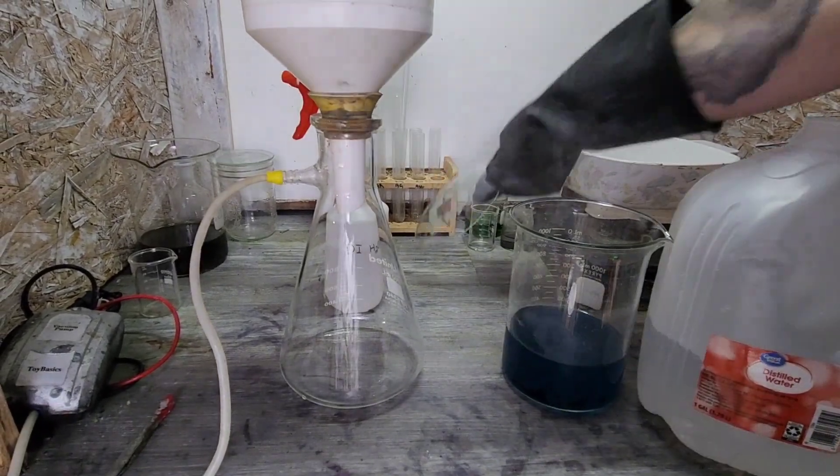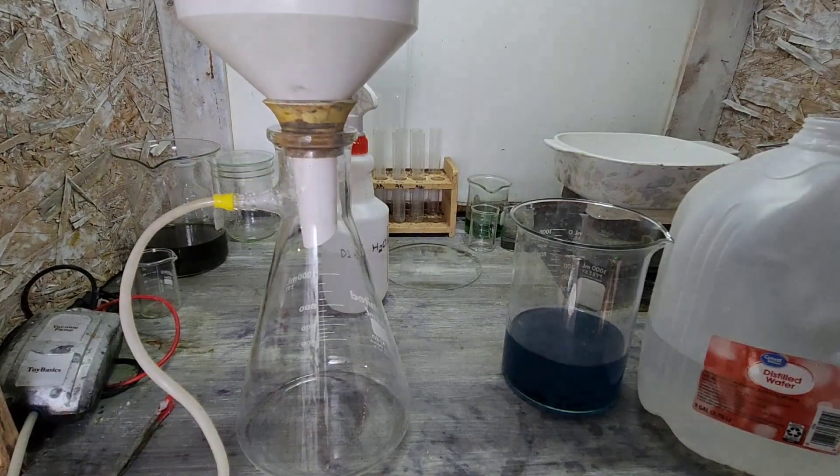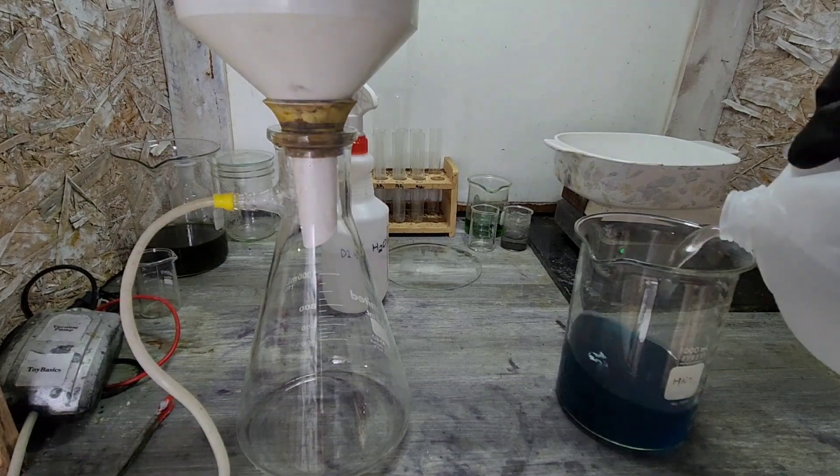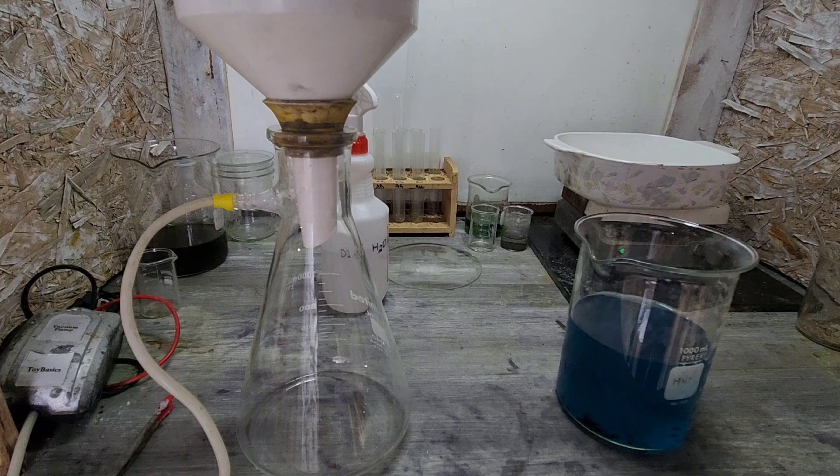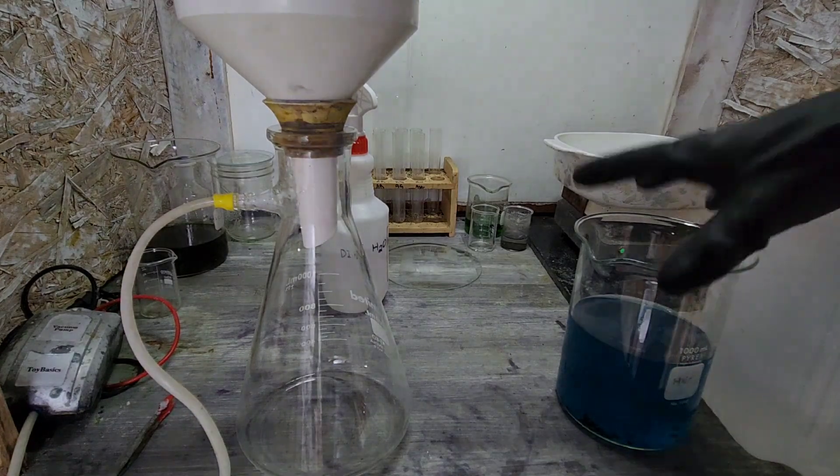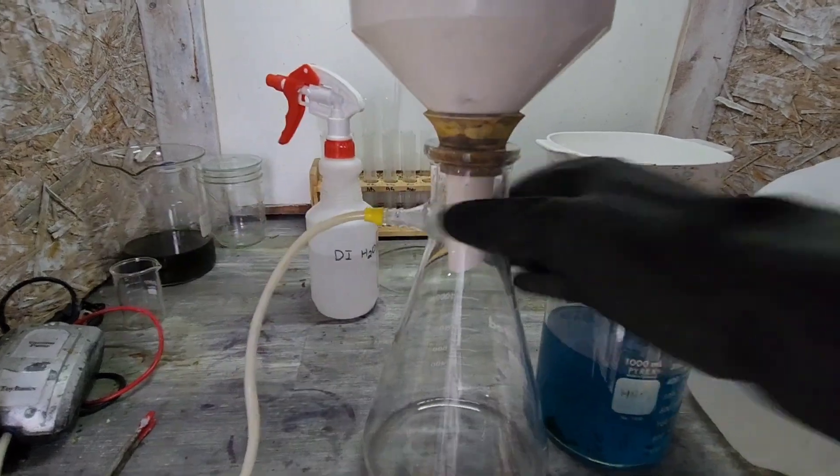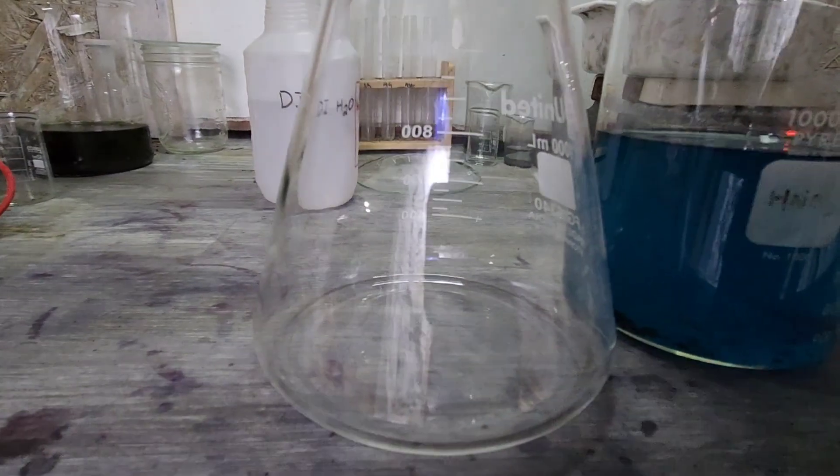Let's get you situated here a little bit. Move the top so that doesn't break. Get that a little closer. All right, we're going to dilute this a little bit so it goes a little faster. Also, it'll cool it down so we're not going to eat up our filter. And let's see here.